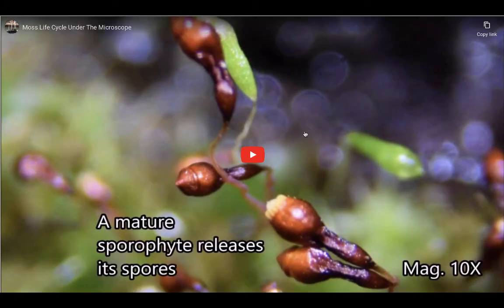Okay, so now, we saw that generalized, simplified diagram of the alternation of generations. So what I thought I would do is, let's first watch the video to look at what it looks like underneath a microscope, with all these different parts on a moss. And then we'll actually go into a cartoon that represents it as well.